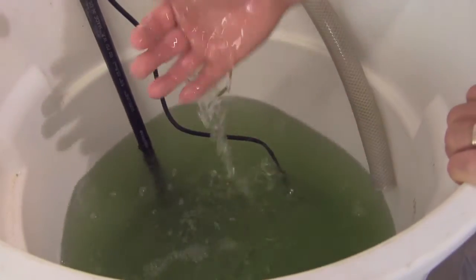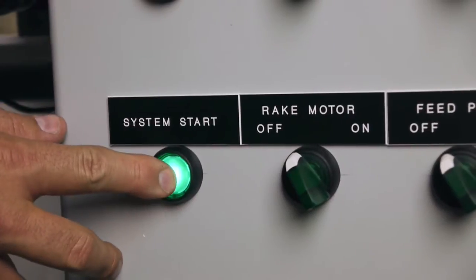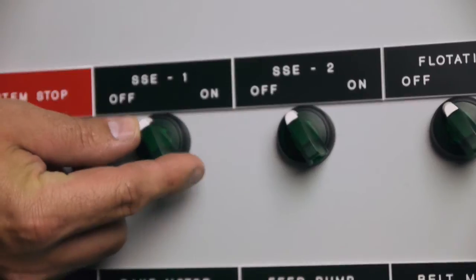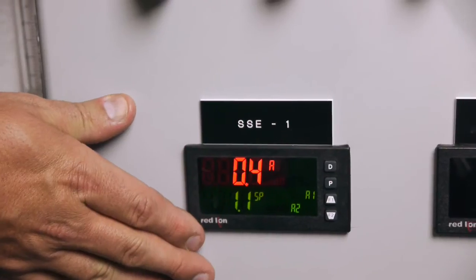This tank has water with microalgae. We're going to hit the system start button. Then we have the first tube. This is our power control module.